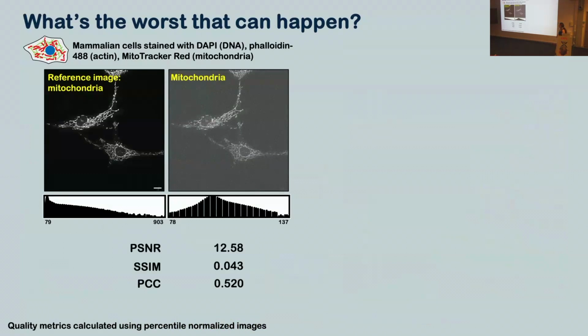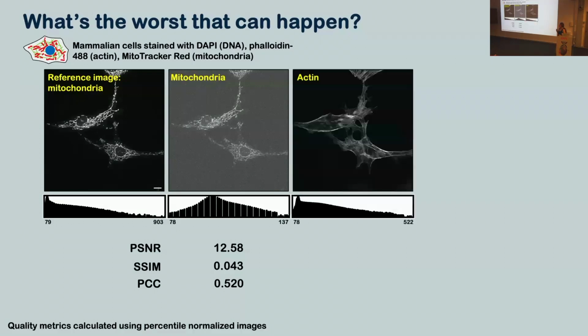And if we put that through our quality metrics, they are underwhelmed, to say the least. They're like, not a great image. Okay, let's do something silly. Let's change color and let's image these same cells in the green channel, which here is actin. So I've got a nice high quality actin image, but it's clearly not the same structure. Let's see how my quality metrics rate my actin compared to my reference mitochondria. Okay, so we've increased our PSNR value and we've increased our SSIM value, but our Pearson's correlation hasn't got any better.